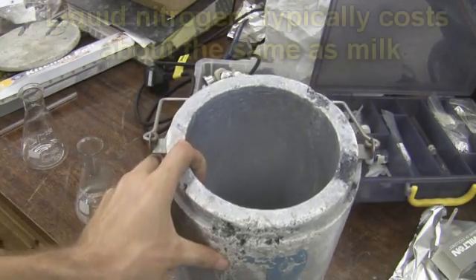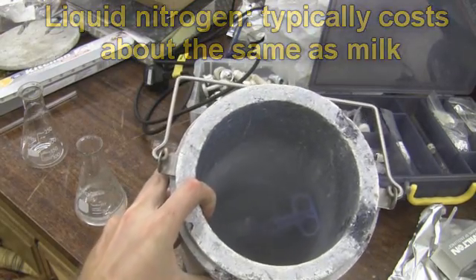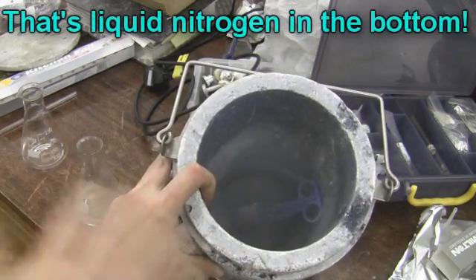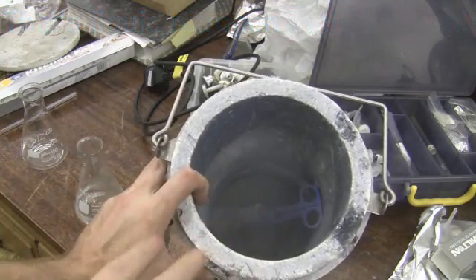One of the big problems with liquid nitrogen is virtually everything condenses in it. So usually it's actually quite hard to see the liquid itself, and the simple reason is any water vapor or whatever that gets in there instantly condenses and fogs the whole thing up so you can't really see it.